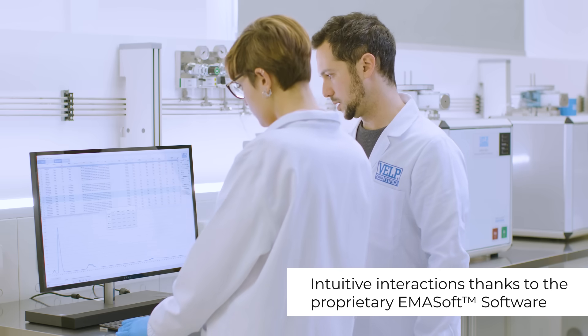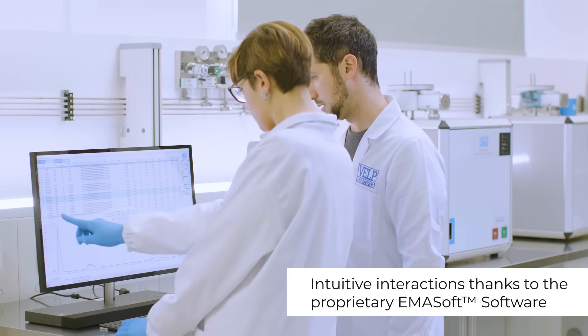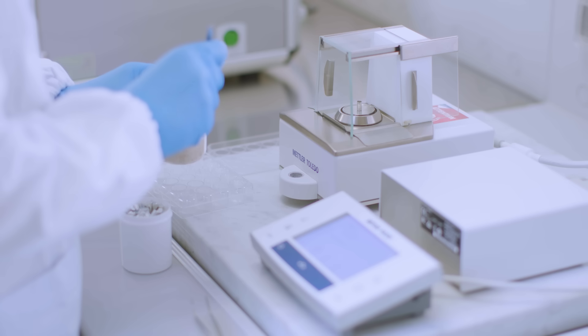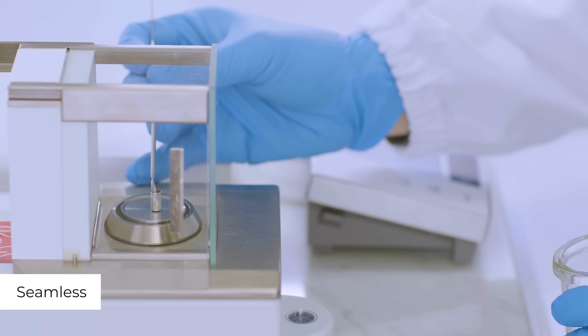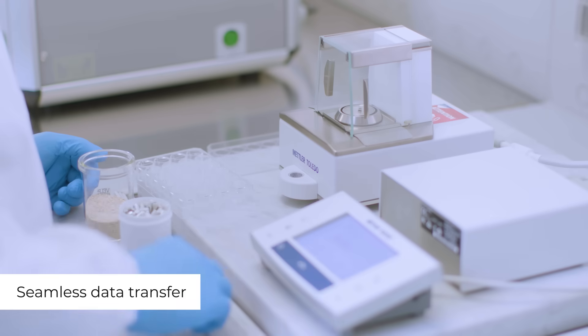The proprietary EMAsoft software controls the EMA502, ensuring maximum ease of use. Start the analysis by filling in the database on the EMAsoft software with all the sample information. Accurately prepare your sample, weigh it, and place it in the tin foil. The weight is automatically transferred from the balance to the EMAsoft.